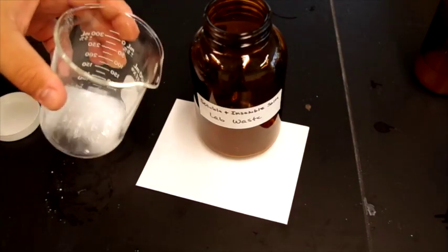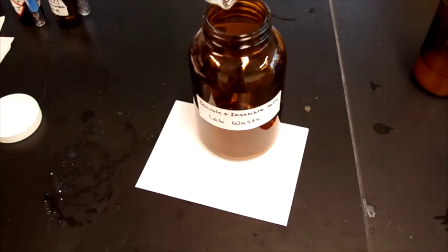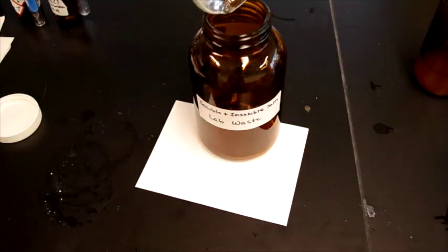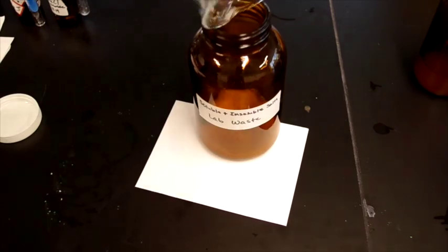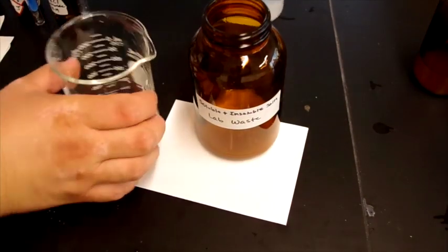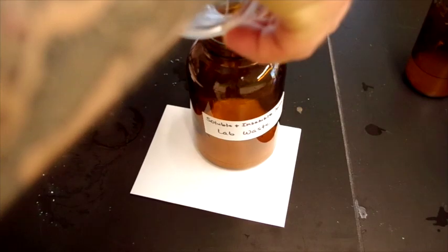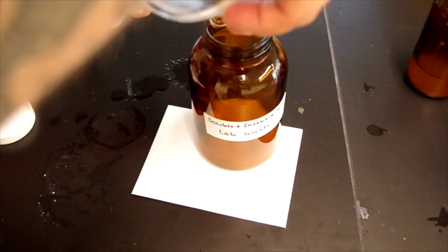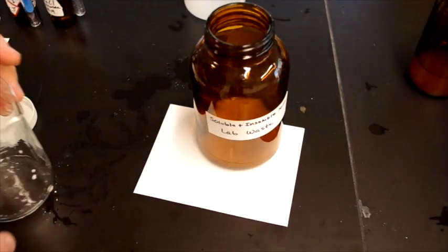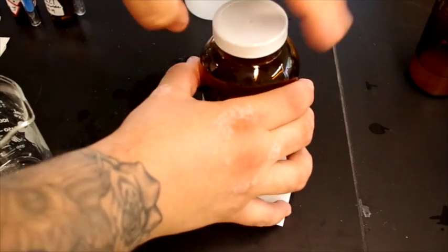So now, as always, we dispose of our chemicals properly. We got all this nasty white gunk, so I've collected it in this beaker, and we'll pour it into our waste container. That's yummy. I have that for breakfast. I'm going to have to rinse it out a little bit with a wash bottle. Man, it's really being stubborn. But we got most of it out there, and we have our handy dandy waste container.